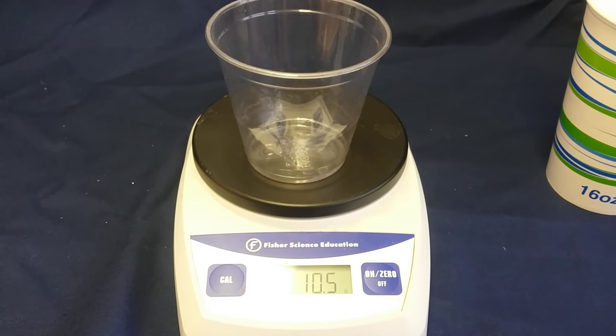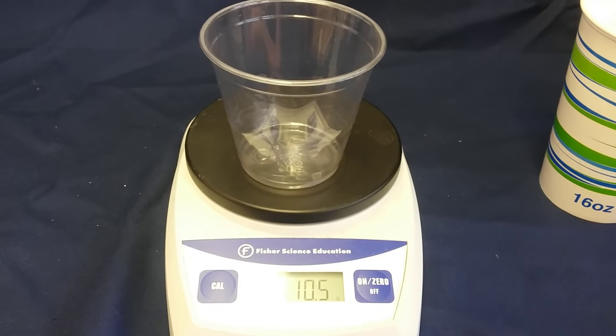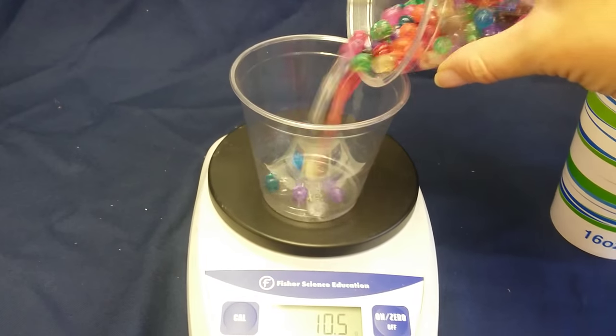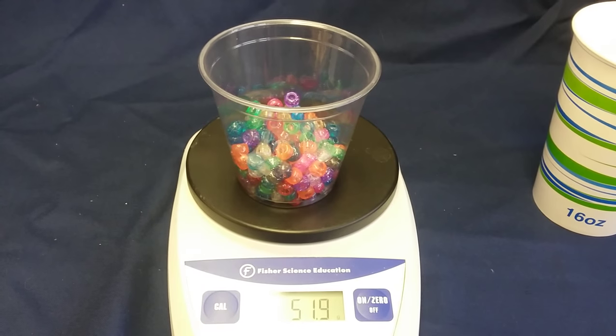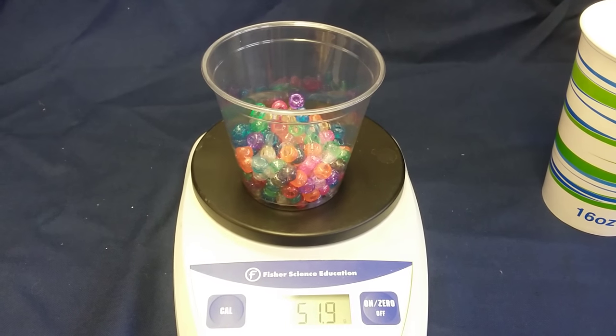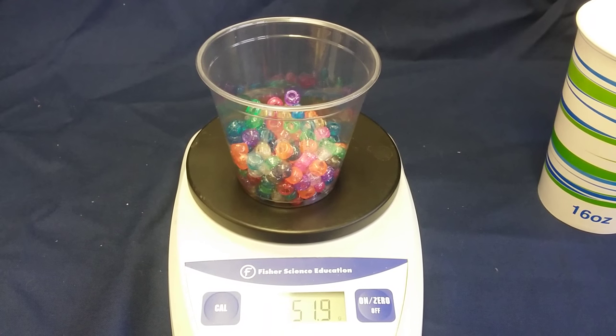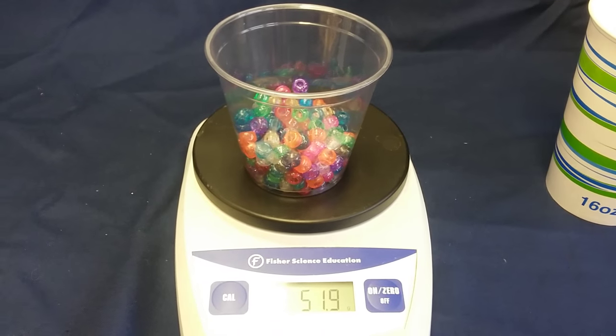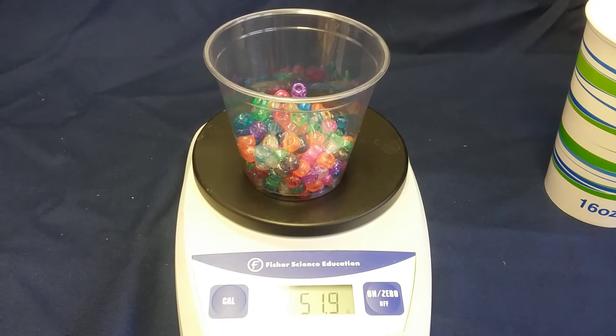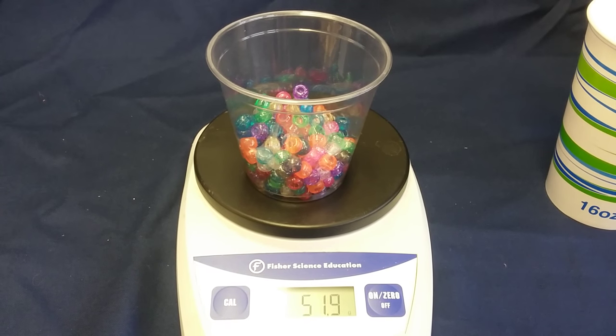The cup weighs 10.5 grams. If I then add the beads, together they weigh 51.9 grams. So if I take away the 10.5 grams from 51.9 grams, I get 41.4 grams. And that is the weight of the beads.